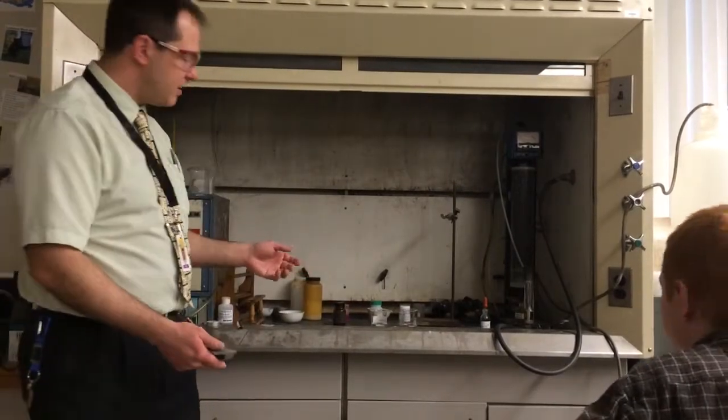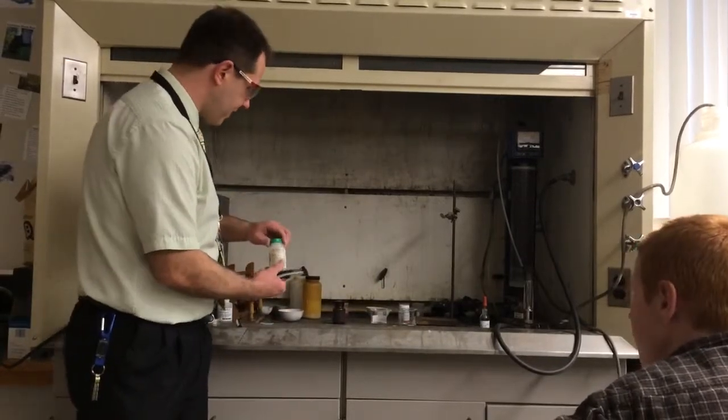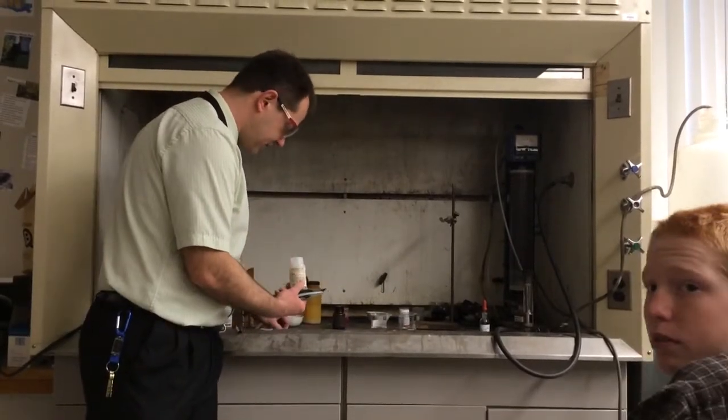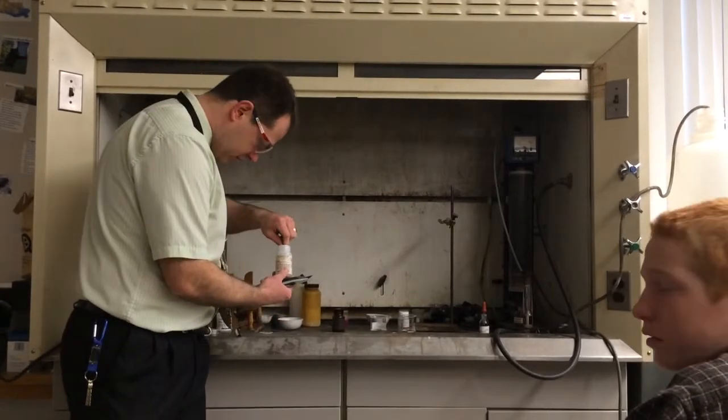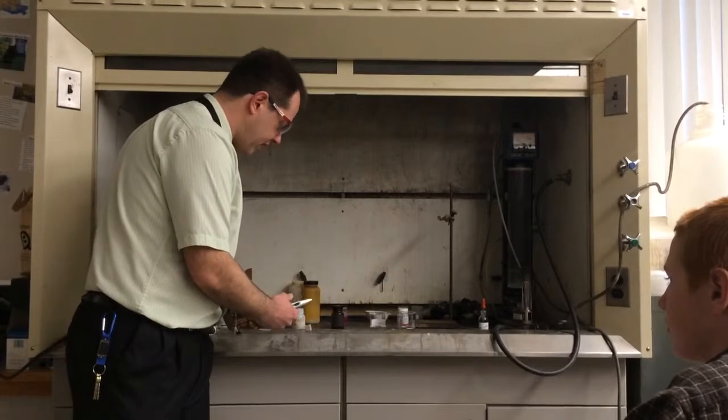Alright, we're going to go down the column, the next element on the periodic table which is sodium. Just put a whole chunk in. That's good. Perfect. No, I can't do that.